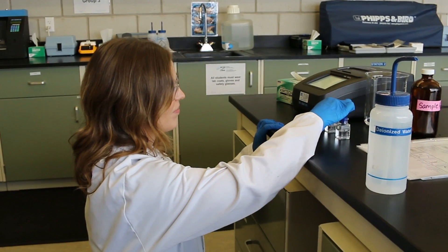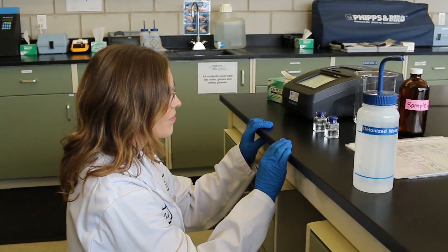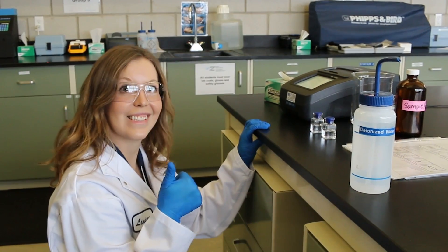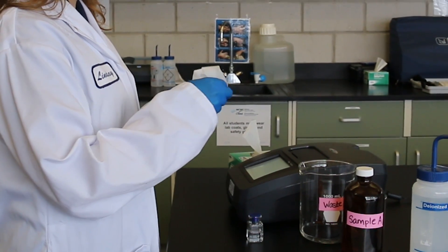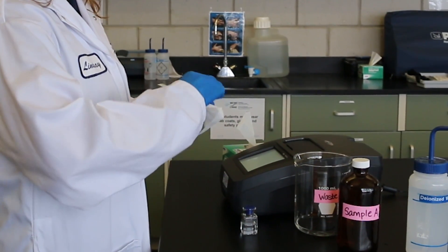Prepare the sample cell by rinsing and filling the sample cell to the level indicated with the sample water. Again, ensure the outside of the cell is fully cleaned, dried, and relatively scratch-free.